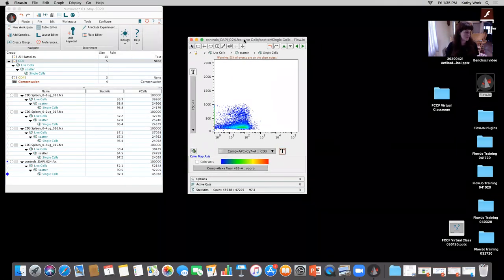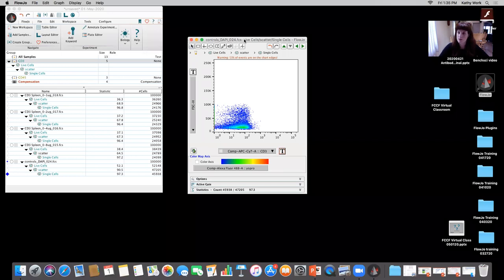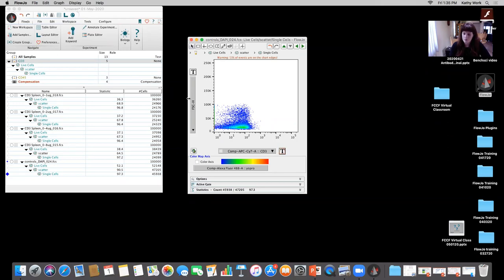Okay. Can I actually, while you're doing that, ask a question here? So there was a question raised whether the scatter gate is necessary at all. It seems that John from FlowJo said that scatter gate would not be required in some cases, or the question was also, can we set up a scatter gate based on the value? So I'm not sure I understand the meaning of scatter gate based on value. What I will say is that exclusion of debris is going to be very important if you want accurate statistics, okay? Because if you have a high amount of debris in your sample, likely that's going to be negative for whatever markers that you're looking at, and it's going to skew. It's going to make it a little bit messier.